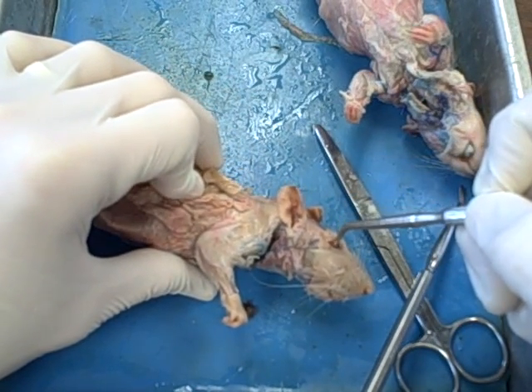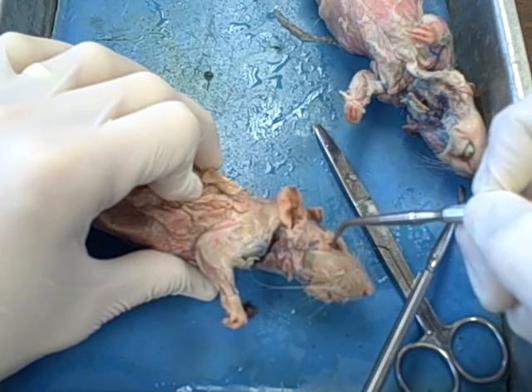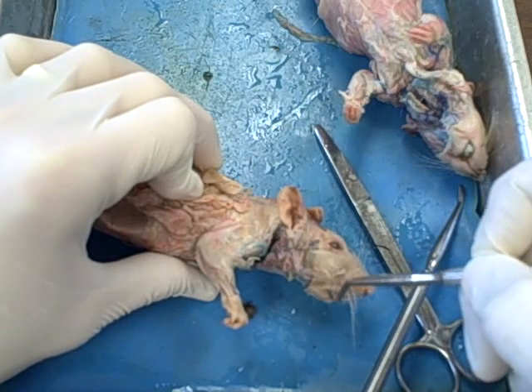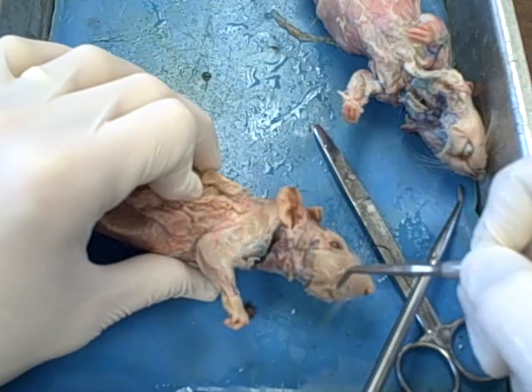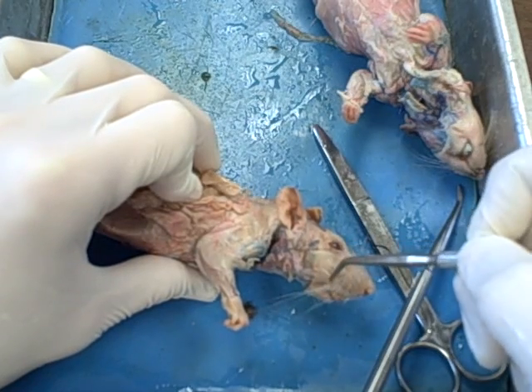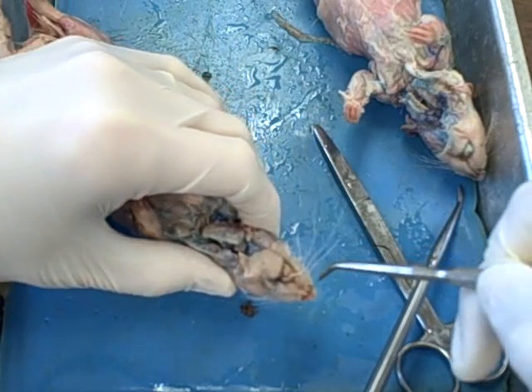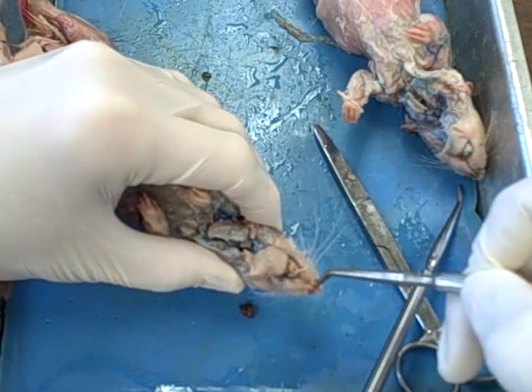Besides the pinna, obviously we have the eye here. Closing the eye, the rat has a pair of eyelids that you need to know. The whiskers, the proper terminology for whiskers, are vibrissae, because they are sensors of vibrations. Beyond that, just like on the shark, the openings on the nose are the nares.